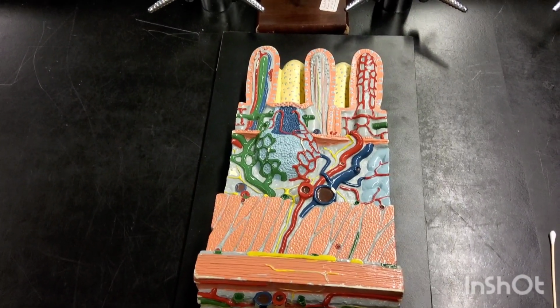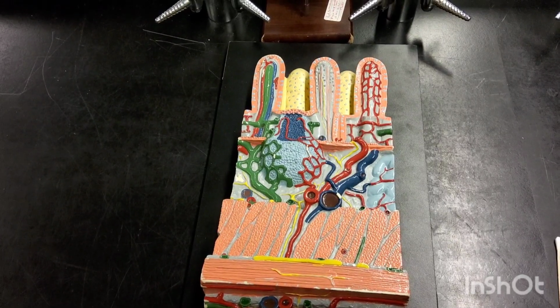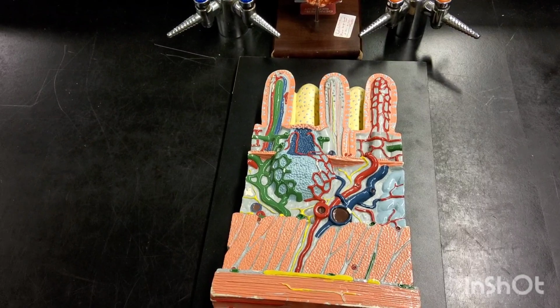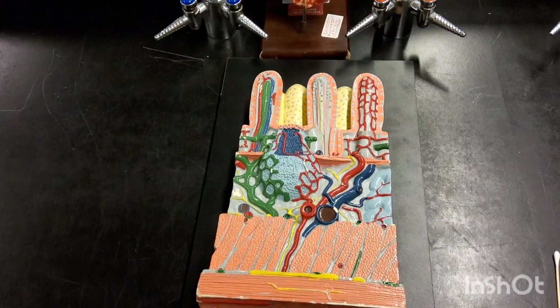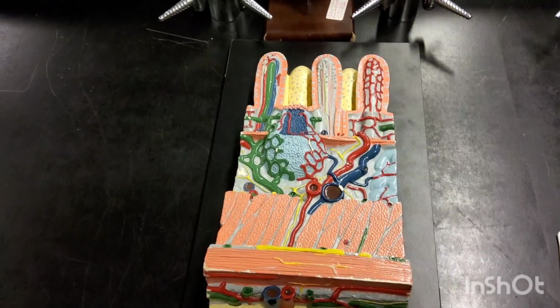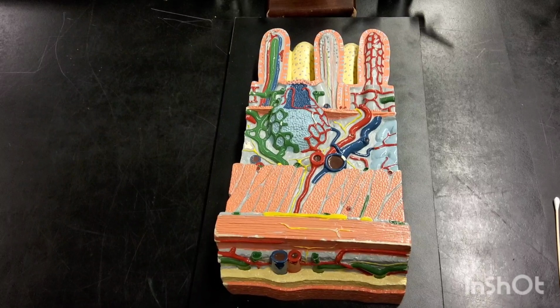Next up, we're going to look at microscopic layers of our digestive tract. Now the cool part is these are going to be the same 4 layers from our esophagus to our anus, and they don't change too much. There will be some that we look at in the small intestine with unique characteristics, but other than that, this is what we'll see throughout the entire gut tube.